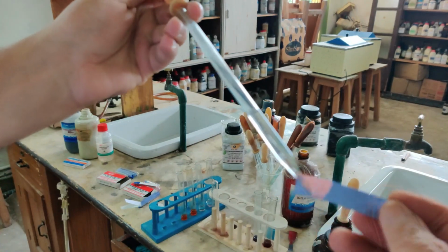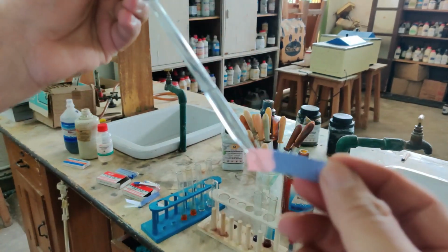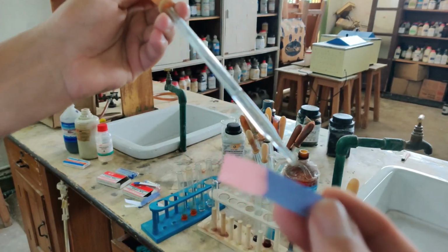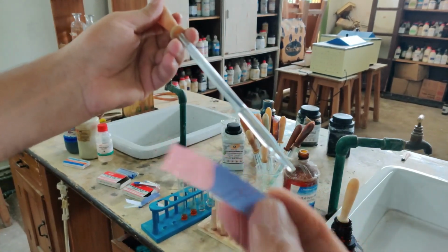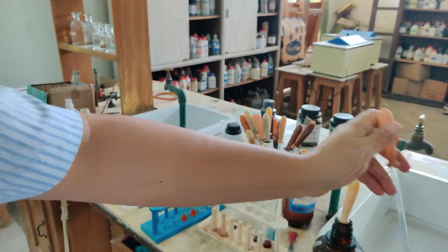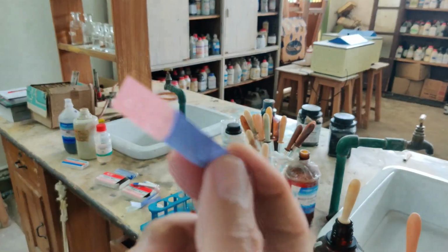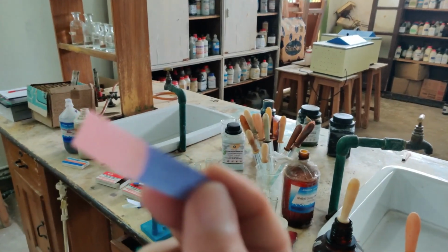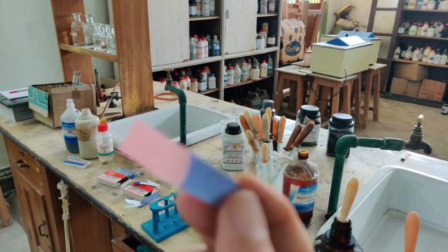See, I am adding this. So you can see that the color of the litmus has turned to red. So blue litmus turns red. So for convenience we use a paper. Actually you know that litmus is a solution, but for convenience purposes only we are using the paper. So you can see how nicely it has turned the color. So this is what has turned to red.